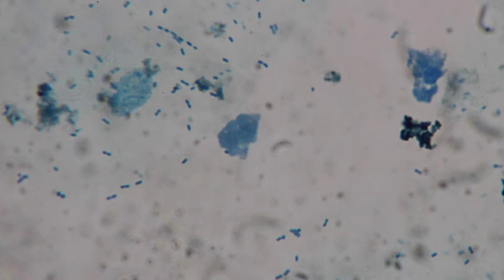You can see how big the nucleus is, right? And then a cheek cell is a lot bigger than the nucleus. So with bacteria, you can see how tiny they are compared to the eukaryotic cheek cells in our mouths.